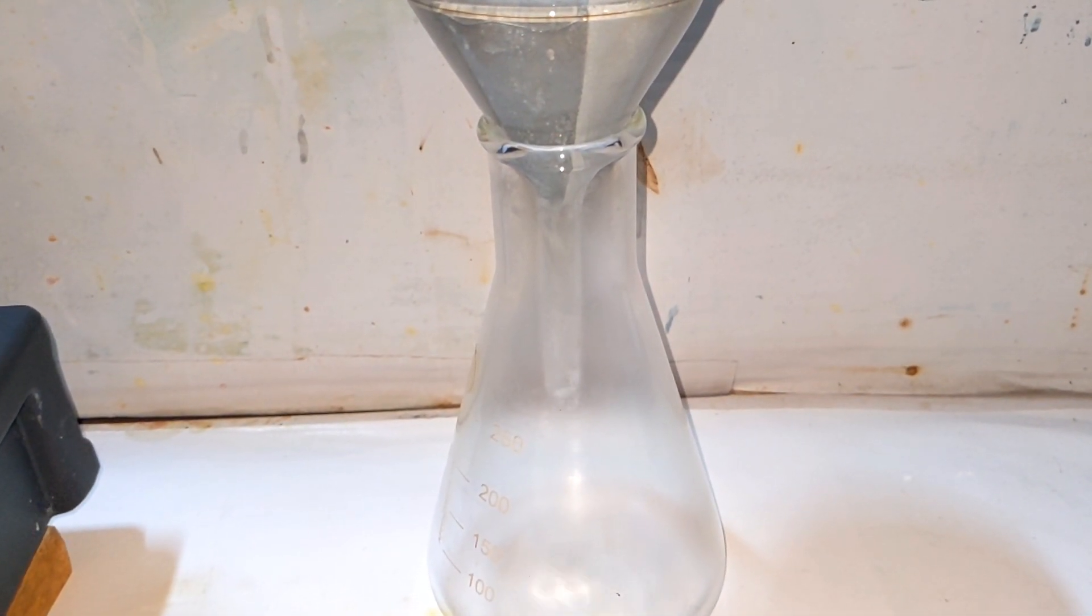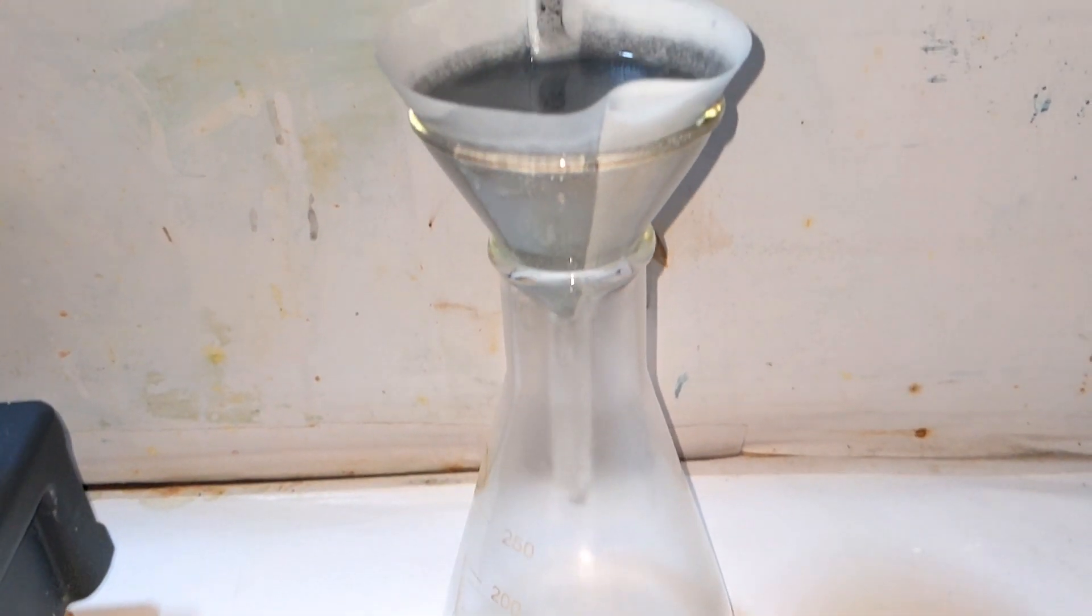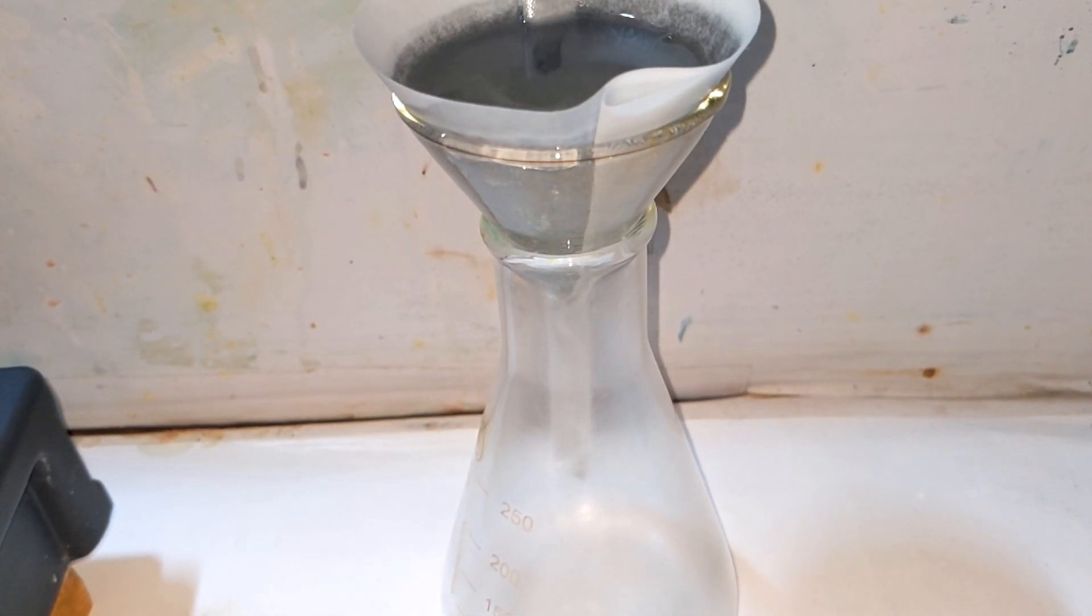Finally, a time comes that even after adding the hydrogen peroxide the reaction is not proceeding forward. This means the end of the reaction and we go on with filtration.